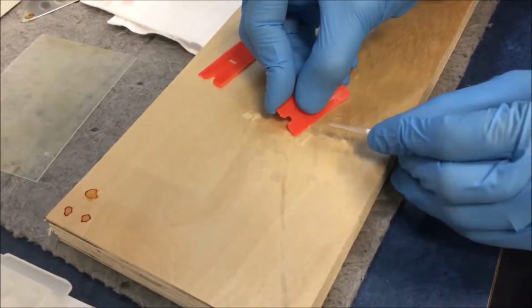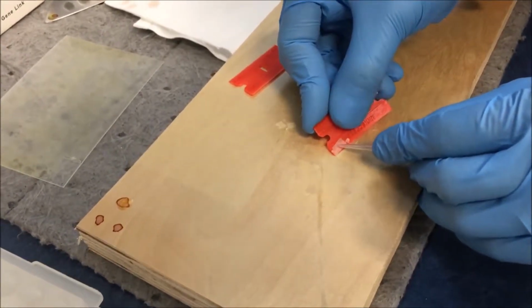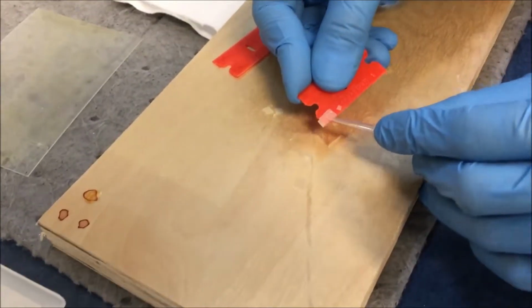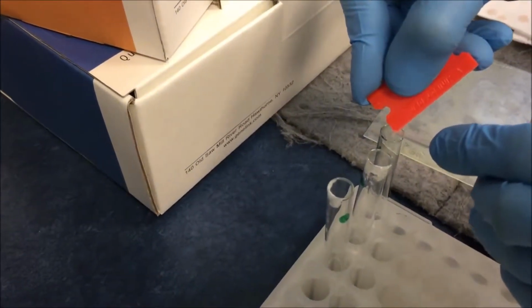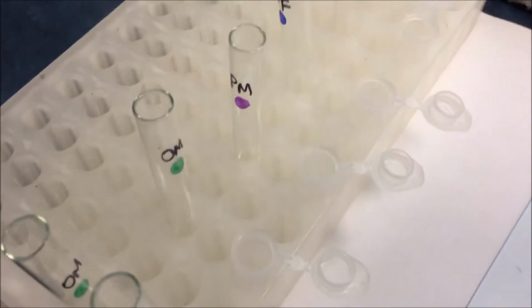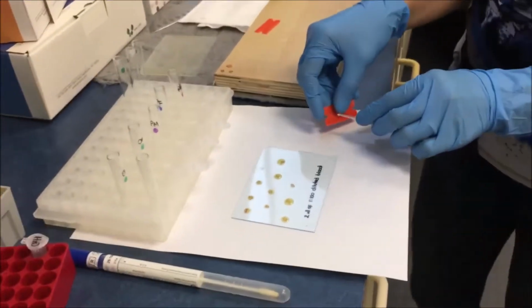This is the sprayed fingerprint suspected area on the wood surface. We are collecting it with a scraper like this, and it just comes up, and now we are going to deposit it directly into a tube, which is similar. In this case, we are using a tube, where we could have used an Eppendorf tube also. In our next session, we will show you processing of these collected DNA samples.